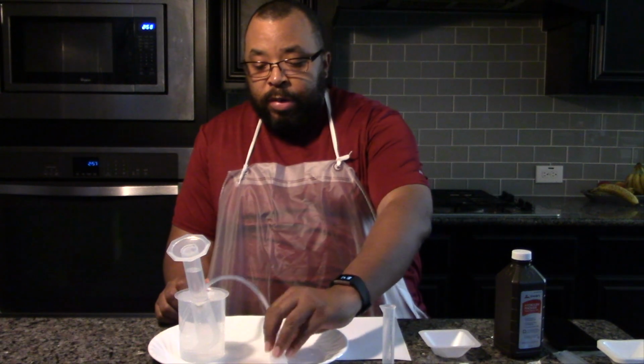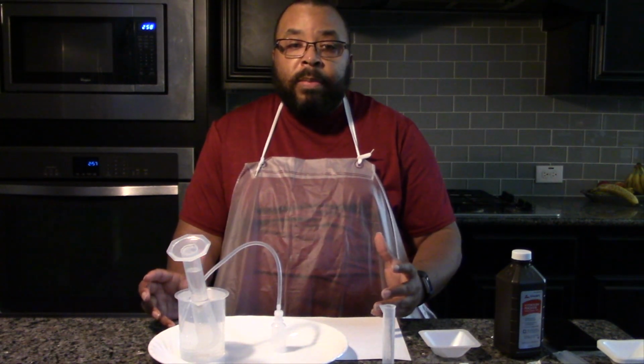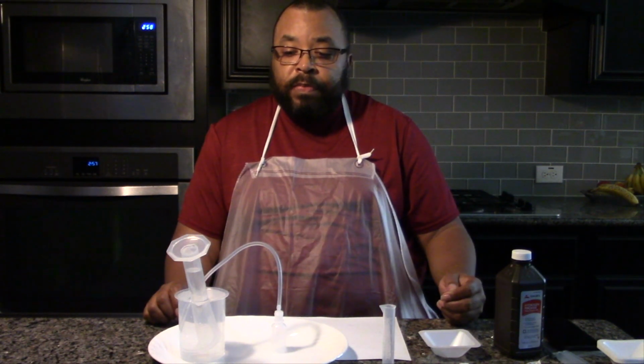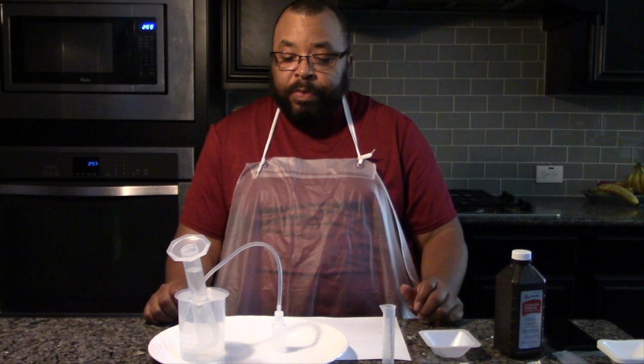the reaction. So what I'm going to do right now is a quick demo to show you how to do this setup to run the reaction and collect the gas. So let's gather our materials and let's begin.